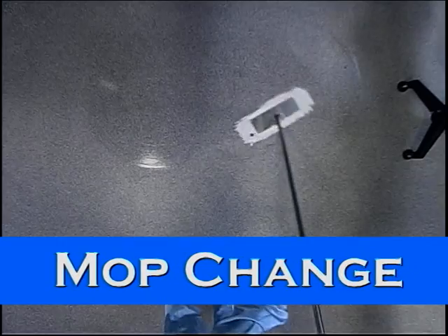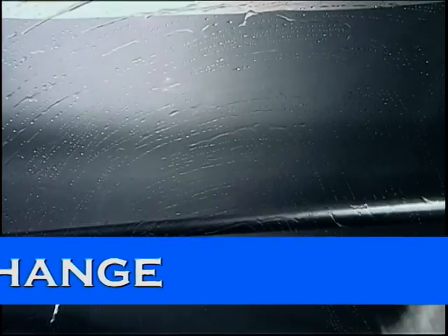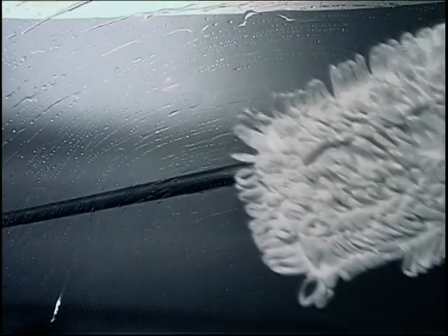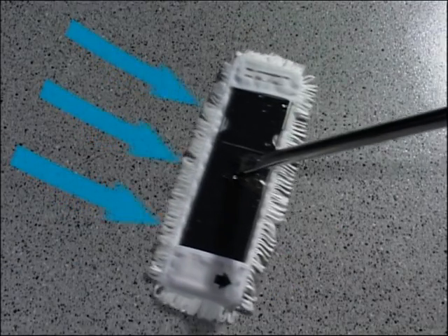So, the mop must be used up after a while. What do you do then? That's quite simple. After about 10 square meters, depending on the floor surface, you will notice a certain amount of friction when pulling the mop, which becomes harder to use. This is a clear signal that it is no longer dispensing enough liquid. Now is the time to replace the mop.